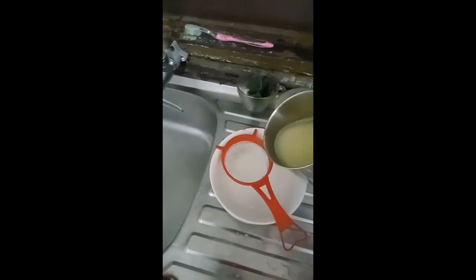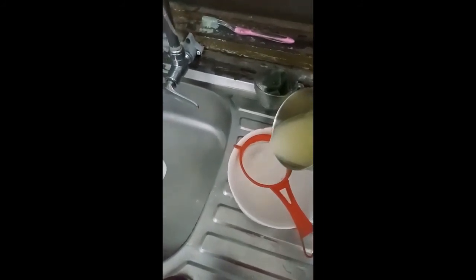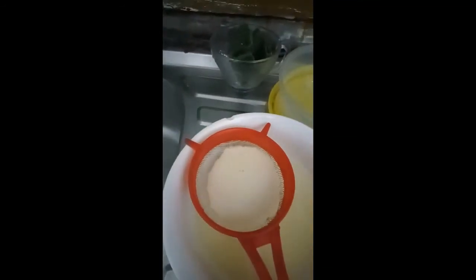The casein seems to be at the bottom when compared to the full cream milk, where the casein was seen at the top easily. The casein is then filtered, and then I will be adding it to the low fat labeled Tupperware to compare it later.